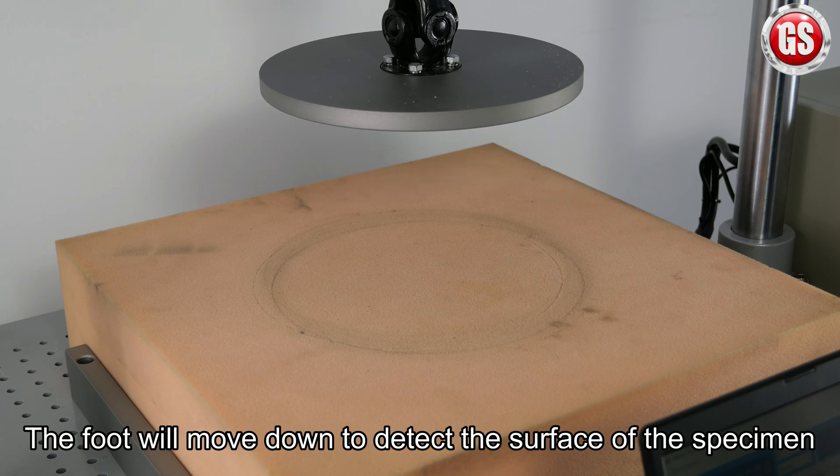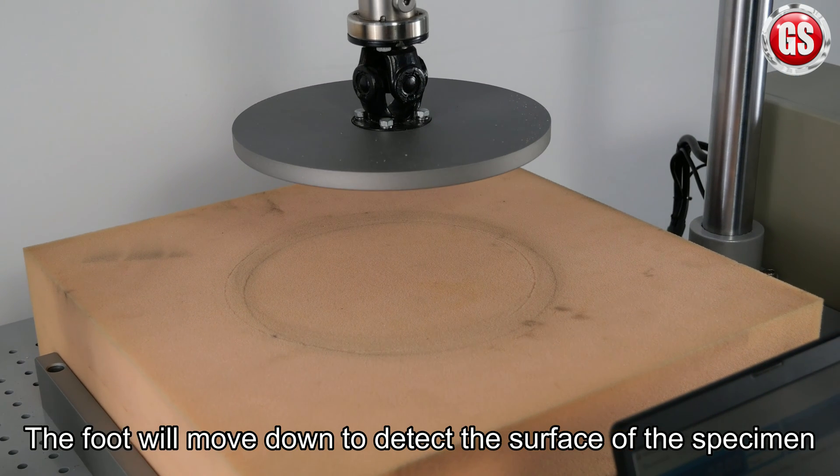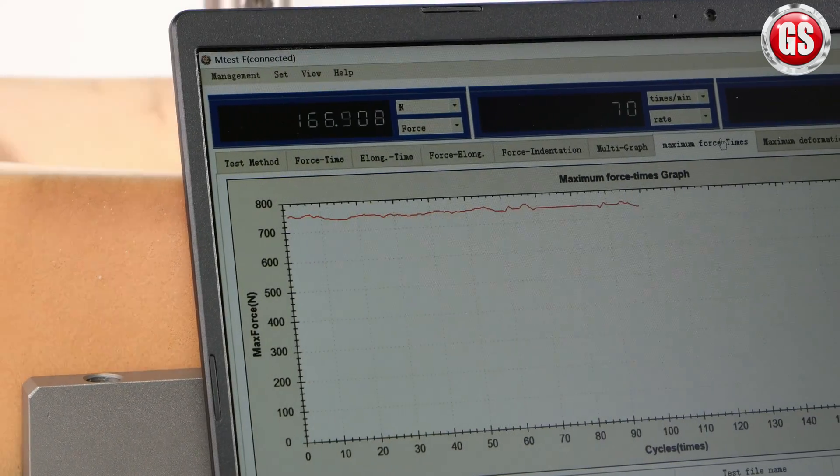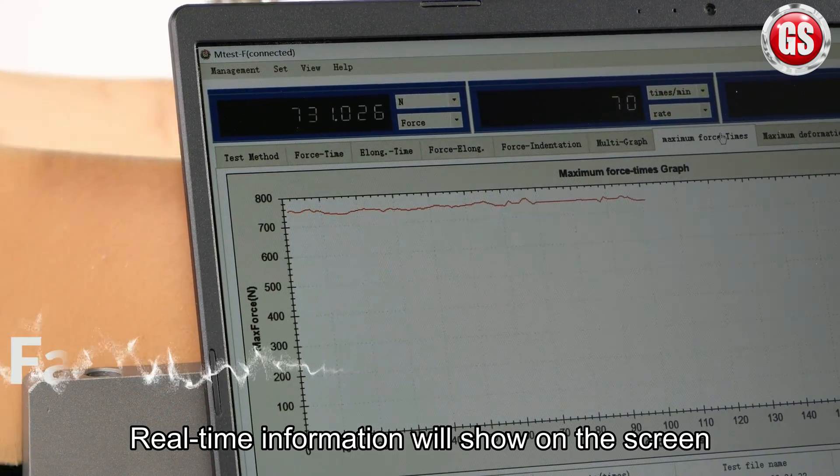The foot will move down to detect the surface of the specimen. Real-time information will show on the screen.